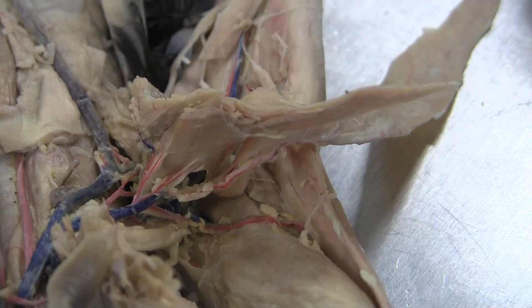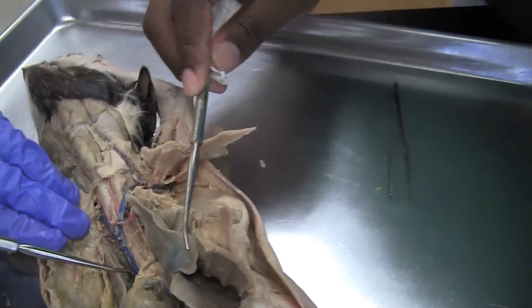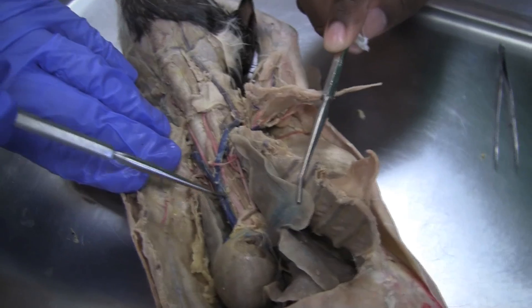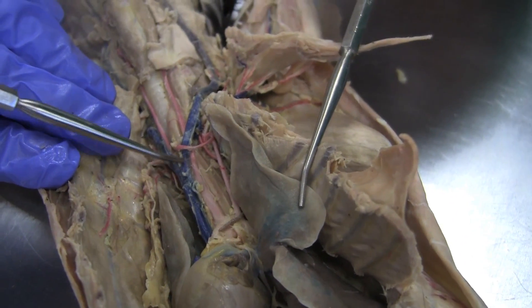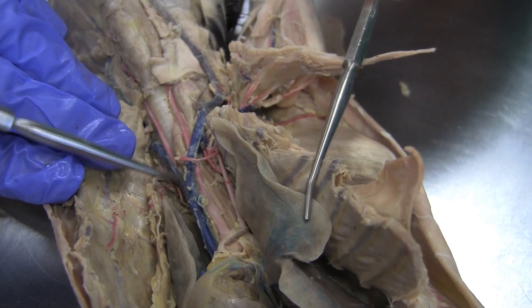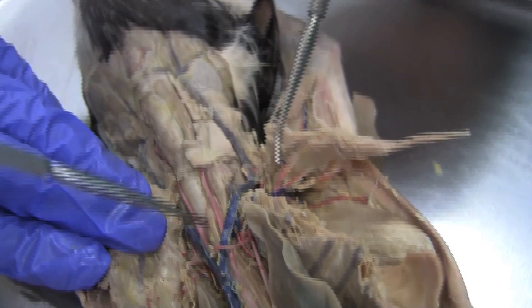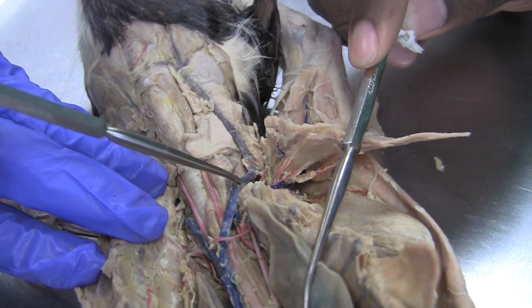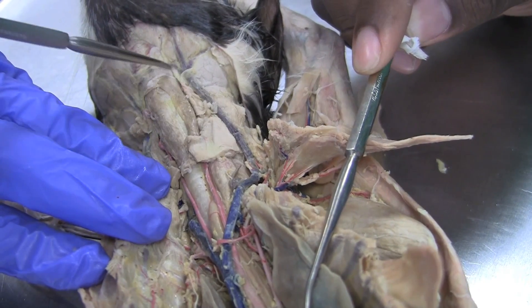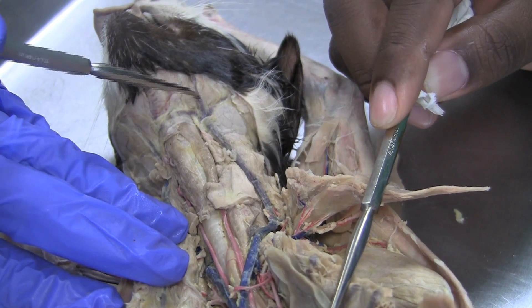Okay, so those are all of the arteries. And then you've got the veins, which are a little bit easier. Superior vena cava. Moving up to the brachiocephalic. And then you move to the external jugulars, which come up here — these are all the brachiocephalic external jugulars. This is the transverse jugular vein.